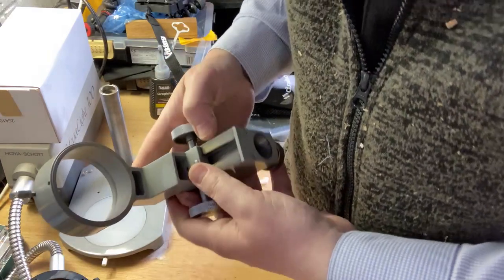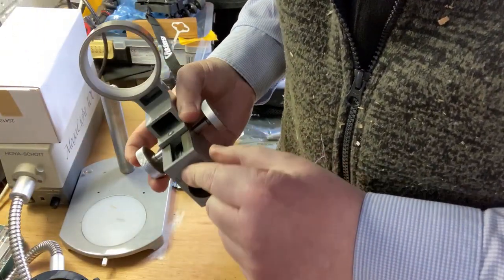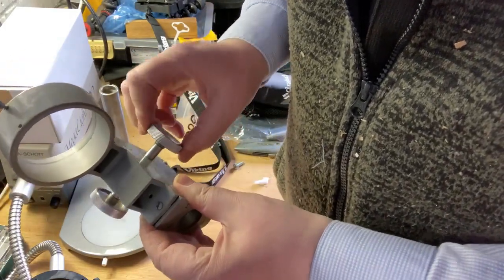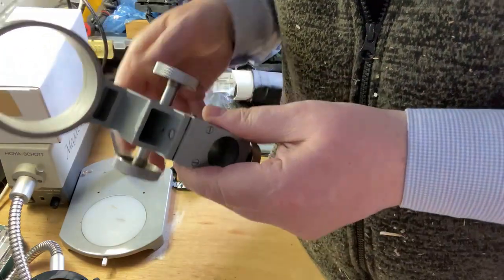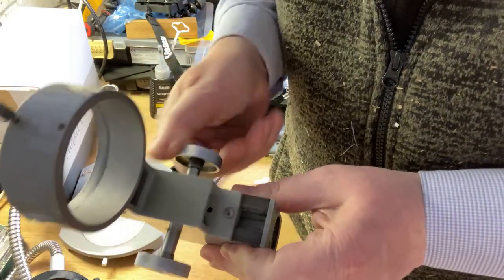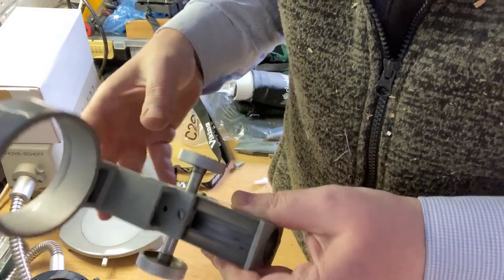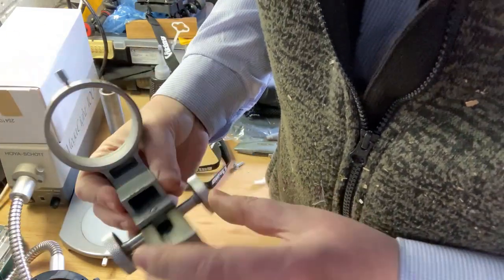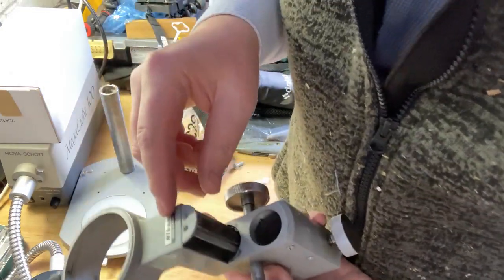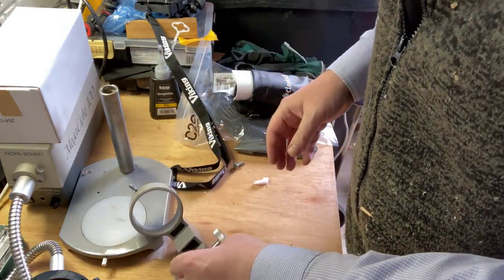So this has got a plate at the bottom, and that is just so that when it comes down, it will actually stop the mechanism at the bottom. It can't go any further. And then up at the top, there's also a little screw at the very top to actually stop it going any further as well. You can actually see that's the screw here. So that's there, and then also there is, I think, just that screw. So let me just take that little screw out.